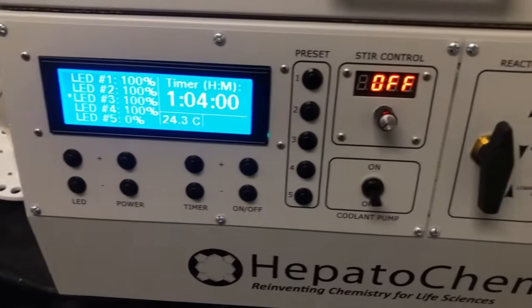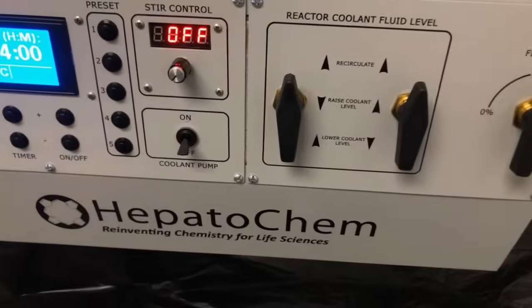Today we're going to do a quick demonstration of the Lucent360 by showing how easy it is to set up a reaction.